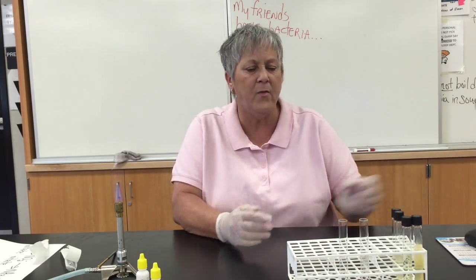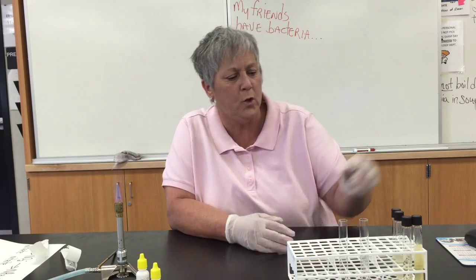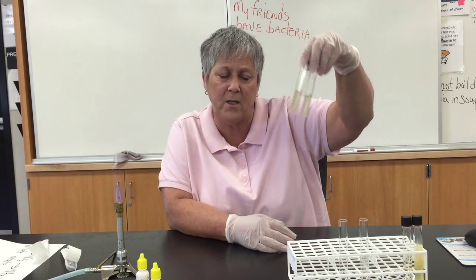One last note: some bacteria are very efficient at taking nitrate all the way to nitrogen gas. If you were to do the test for production of nitrite, it might come out negative. But in that case, you would see some nitrogen gas collected in the Durham tube. I did not see any nitrogen gas in any of these tubes. Typically, members of the genus Pseudomonas, like Pseudomonas aeruginosa, are very efficient at taking nitrate all the way to nitrogen gas, so you would see nitrogen gas in the Durham tube but might get a negative reaction for the nitrite test. In that case, we would make a presumptive decision, knowing that nitrite had to have been produced in order for nitrogen gas to appear in the Durham tube.